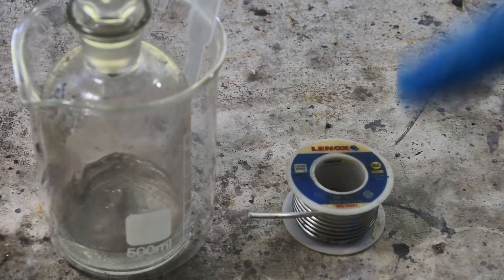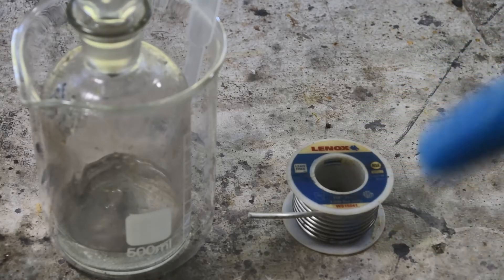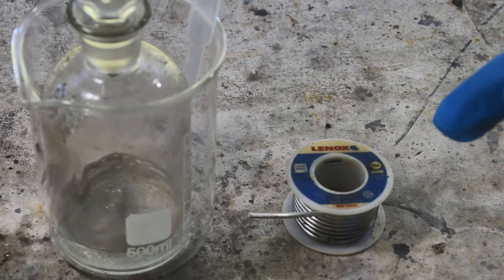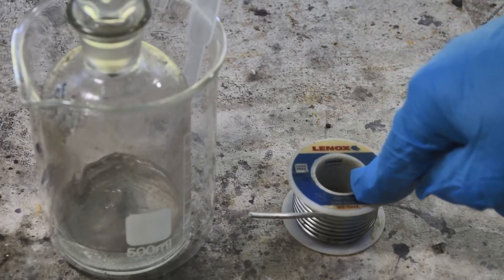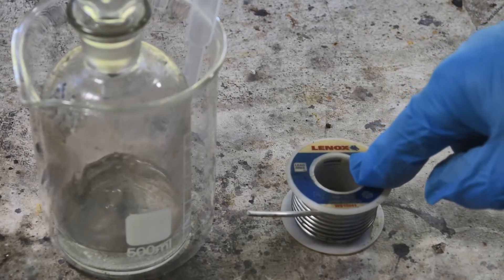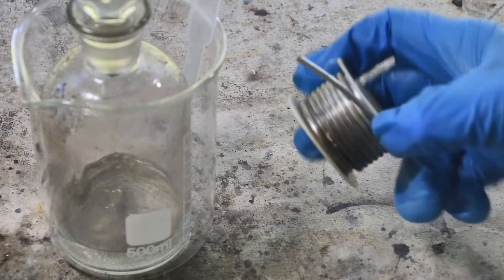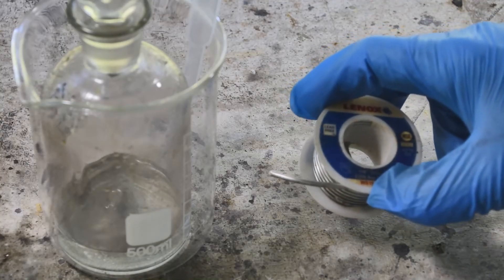This is not pure tin, but it doesn't really matter since we're only going to use this as a testing solution. It's not going to contaminate our gold solutions since we're only using it to test and not putting this stuff into the gold solution. So I got over my desire to use pure reagents for stannous chloride — it's just not necessary. And there's a lot of solder here; you can make a lot of stannous chloride solution with one roll of plumbing solder.